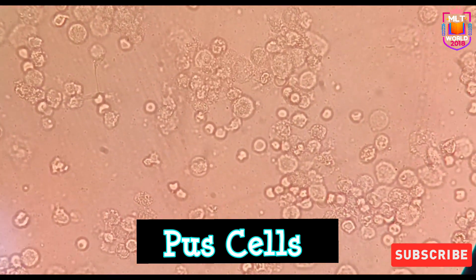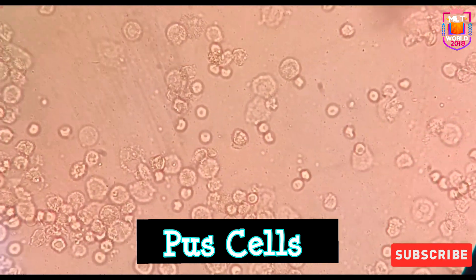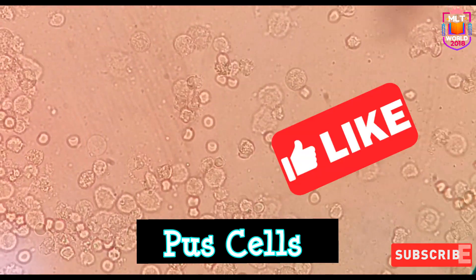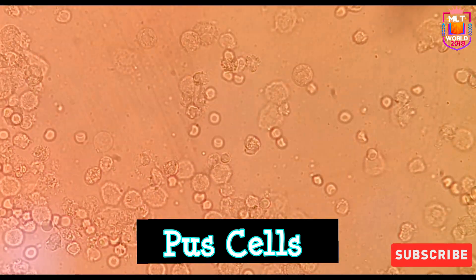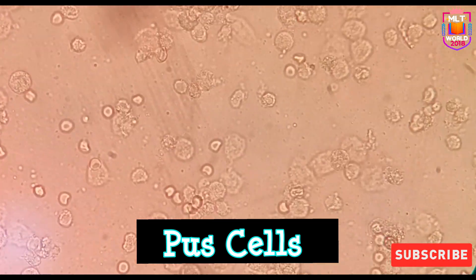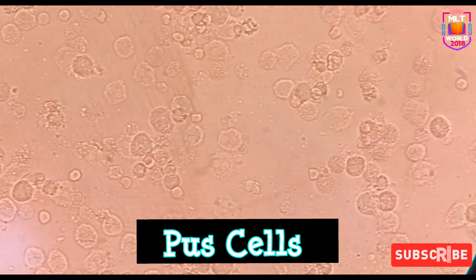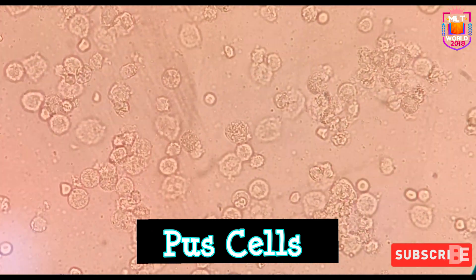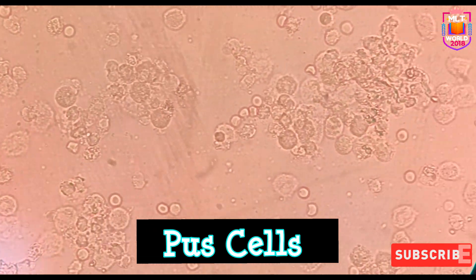The first slide you are watching shows pus cells. How to differentiate? First you will look at the shape, then the size. Pus cells are round in shape and they are granulated. The other smaller ones you are watching are red cells, which are smaller than the pus cells — but sometimes, if they are fresh RBCs, the size will be almost equal to pus cells.